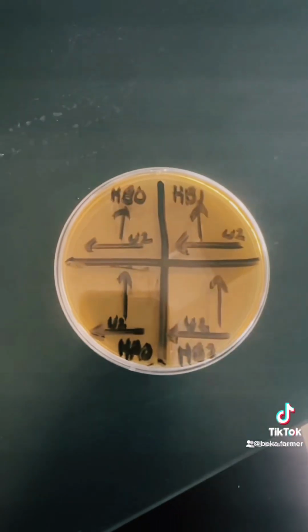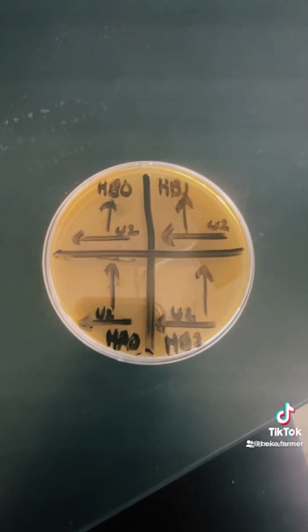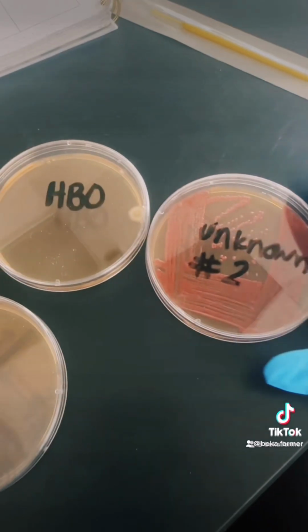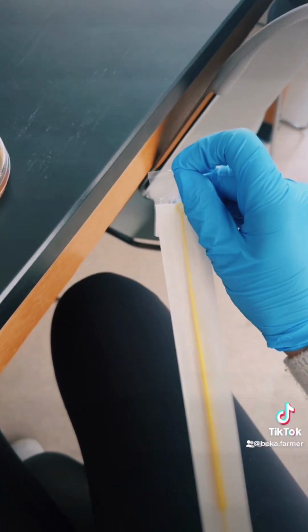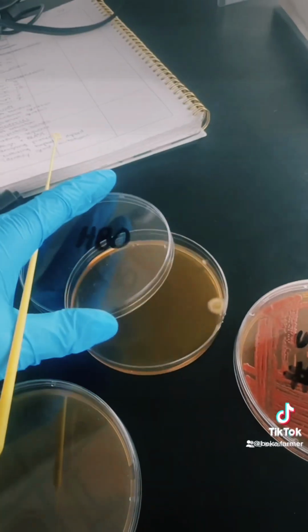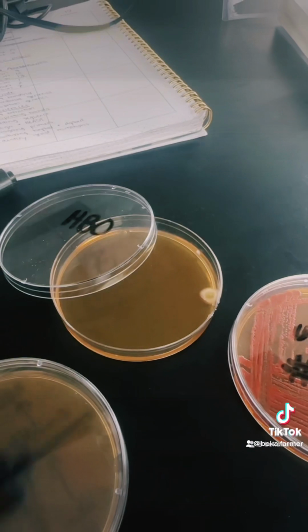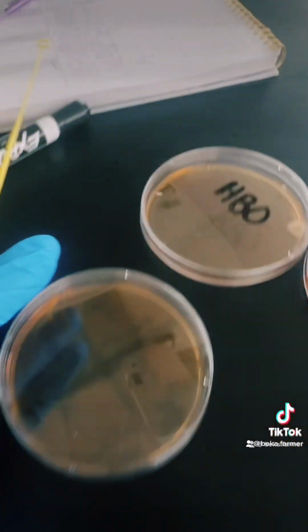And this is pretty much what the completed labeled plate should look like. So you'll go ahead and flip this over, then take each labeled strain, the mutant and wild strains, then you will swab those with a sterilized loop using the correct techniques as described earlier in this semester.